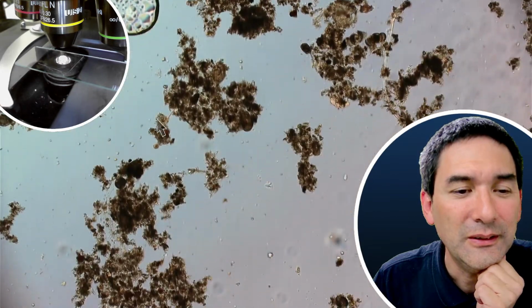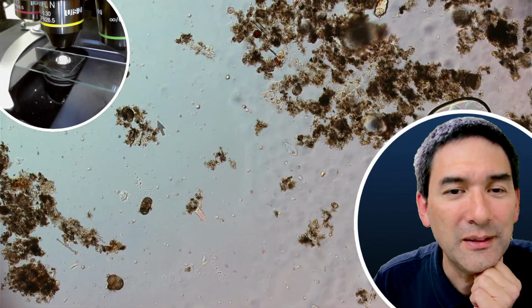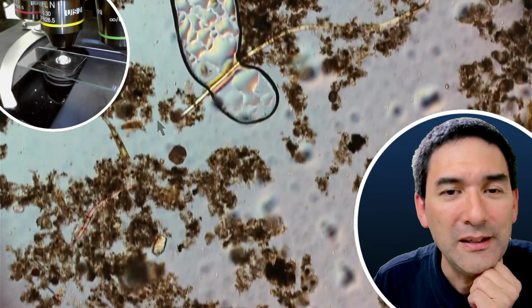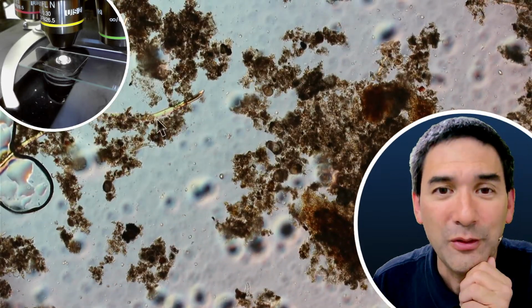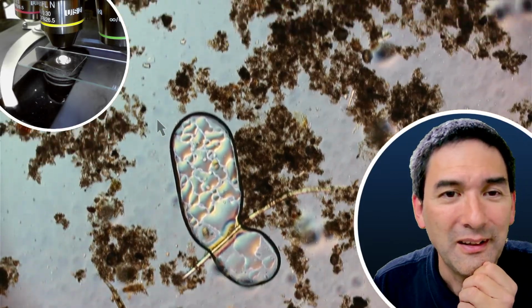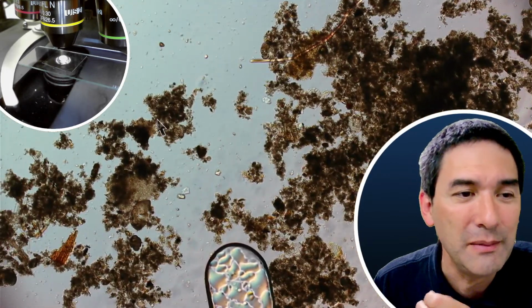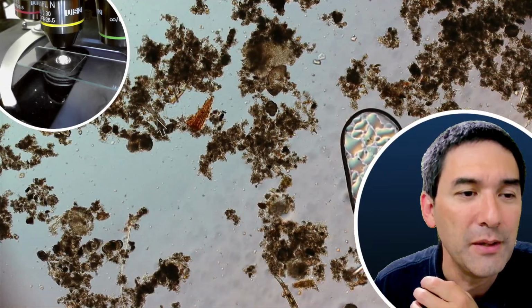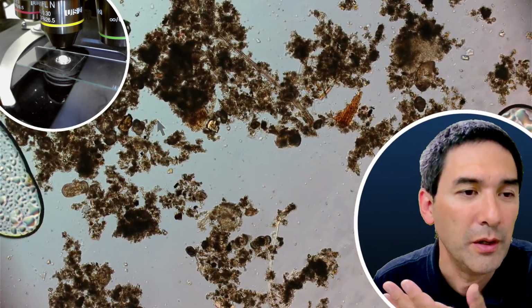I think it's one of the interesting things about microscopy that it's almost a little bit like chasing down things that you want to find, and then if you find them, tardigrades, whatever, you're all happy that you found them. But sometimes, things are not quite as interesting. Actually, that's not correct. Even specimens like this can be interesting if you try to find out what the things actually are that you're able to see. For example, here, as I mentioned before, I was able to find a lot of pollen, which you are otherwise not able to see.